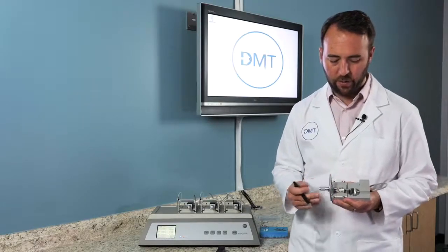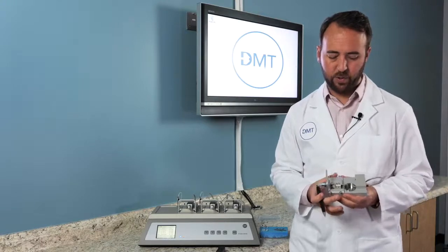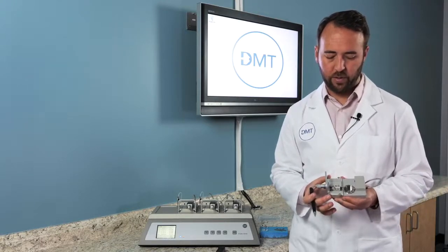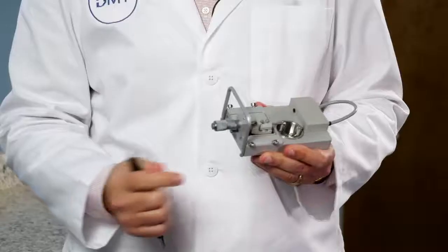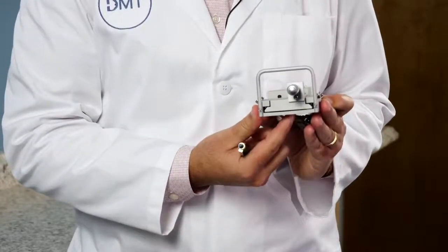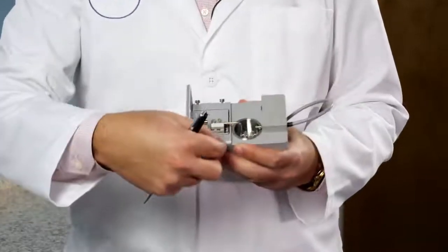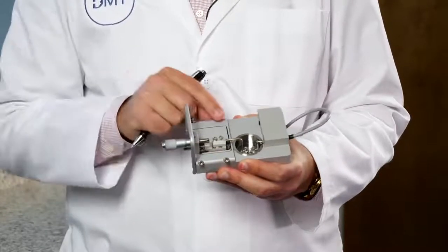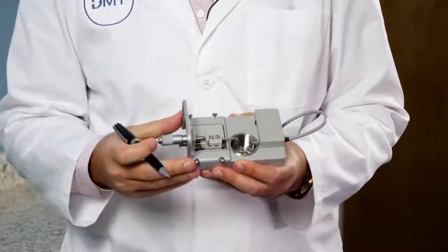As far as the fine adjustments, you have four screws on the chamber itself. There's a pivot point on the bottom of the chamber where as you tighten these screws, you are tightening around that pivot point.